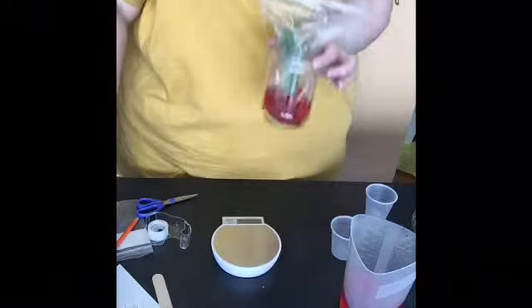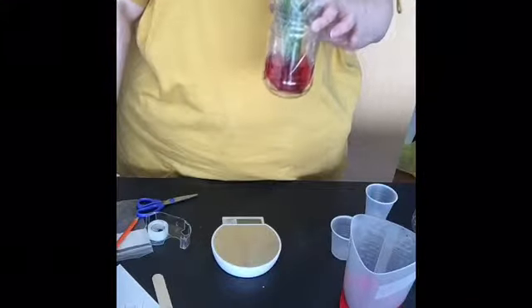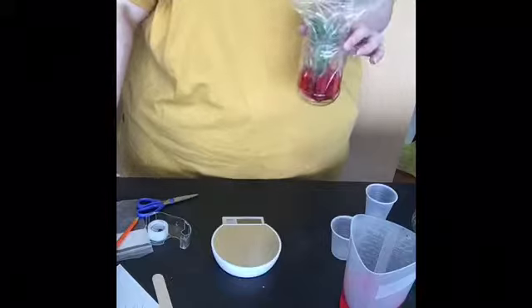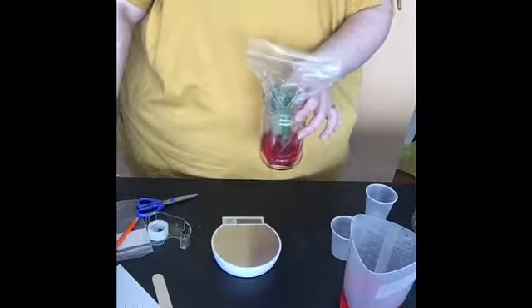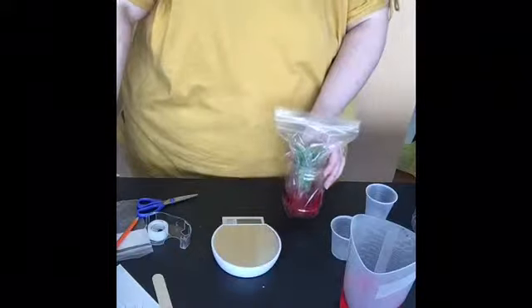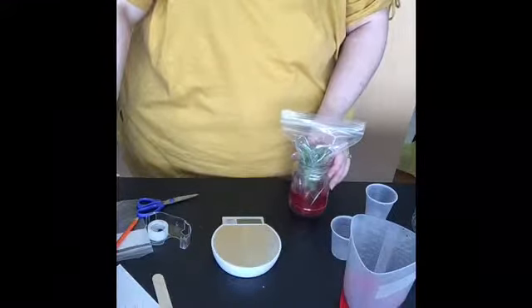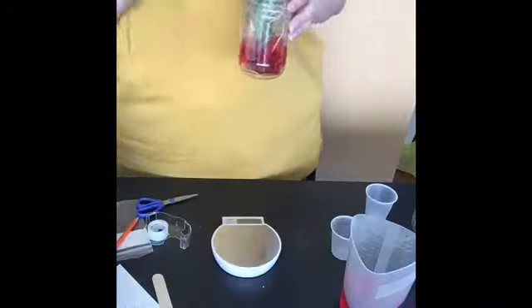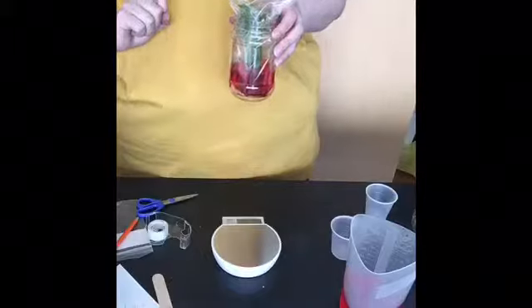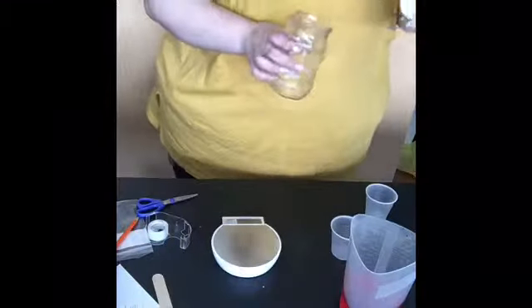I'm going to take this container and put it in a warm location, let it sit for 24 hours, then take the mass again — with and without the celery — to see how much water has evaporated through the celery stalk. This will be my warm water location. I'll put that to the side and make another one for my cold water location.